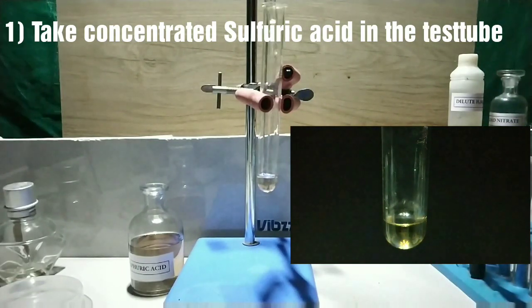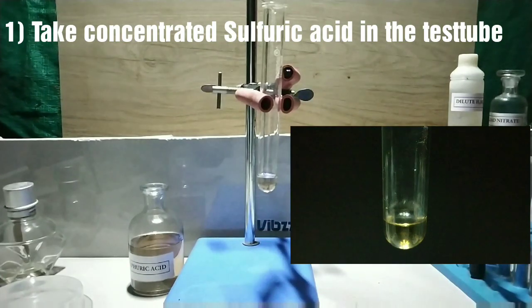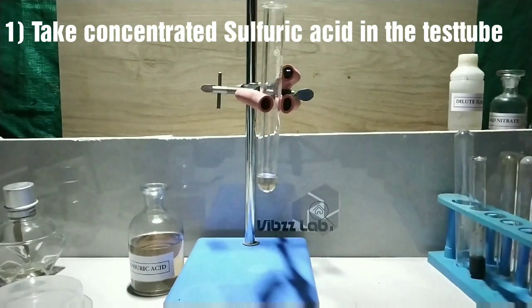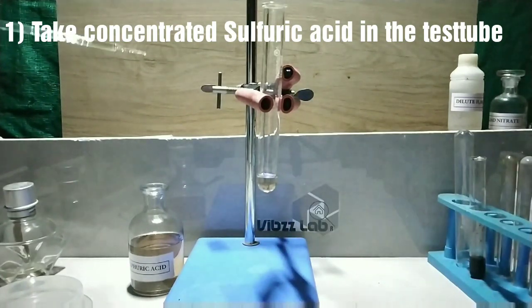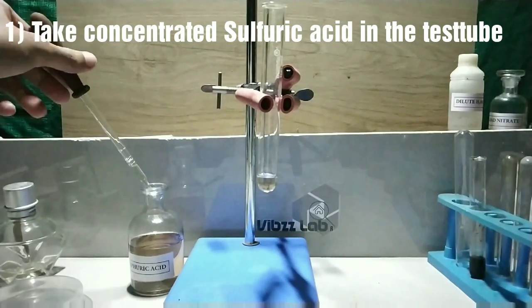Step one is to take concentrated sulfuric acid in the test tube. It should form the bottom layer of the test tube.